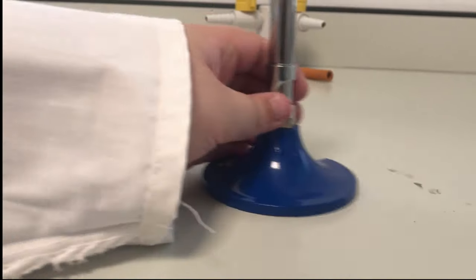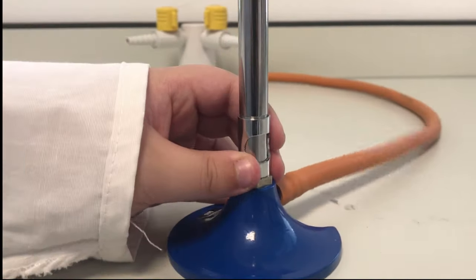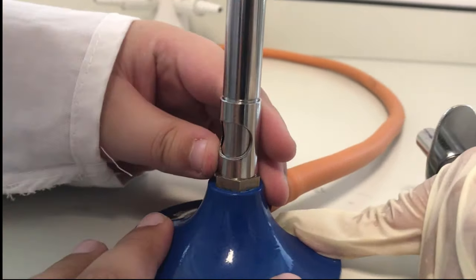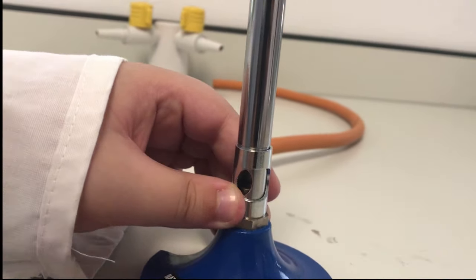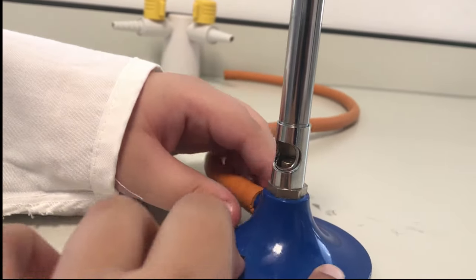This is the collar. What is the collar used for? To have it on safety flame, keep it closed completely like that to get it a bit heated but a bit dangerous.